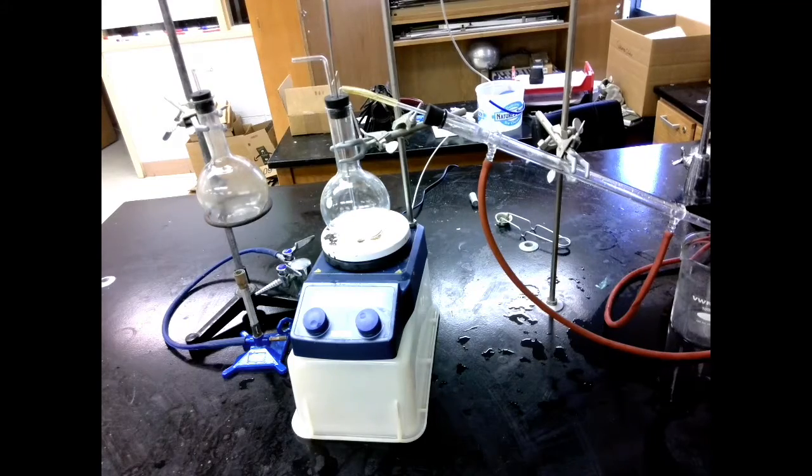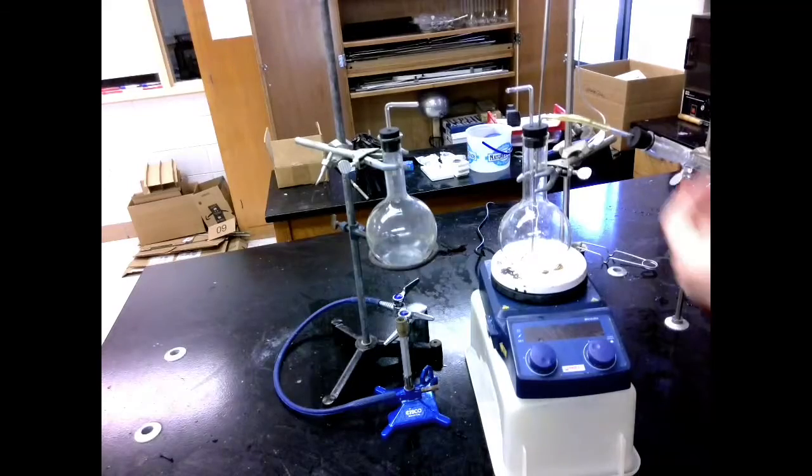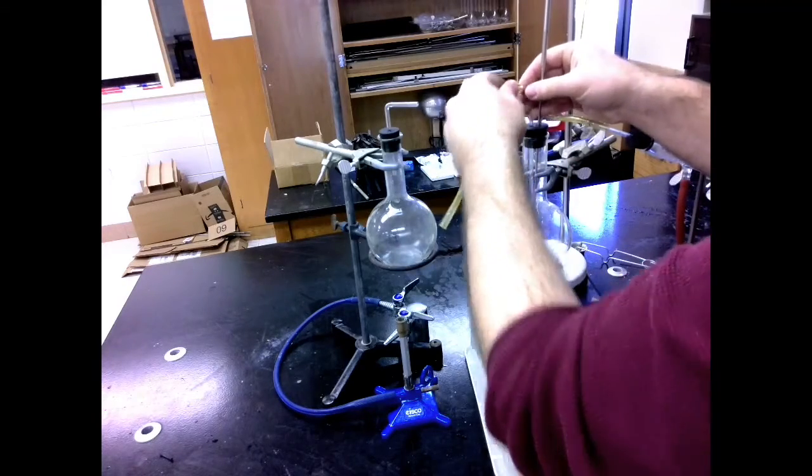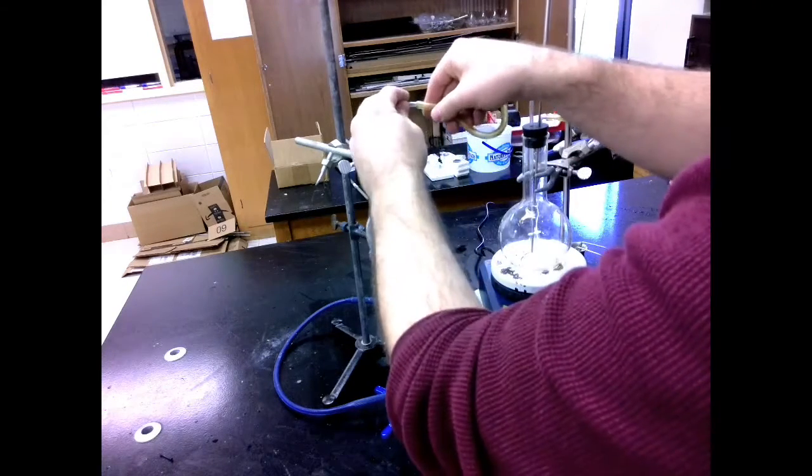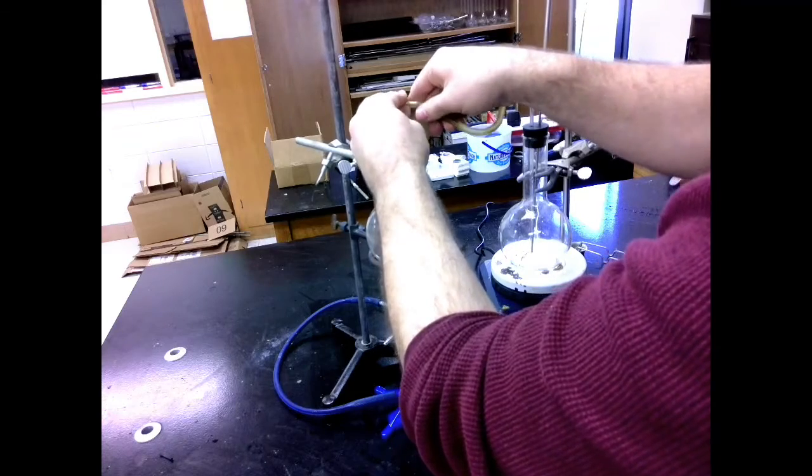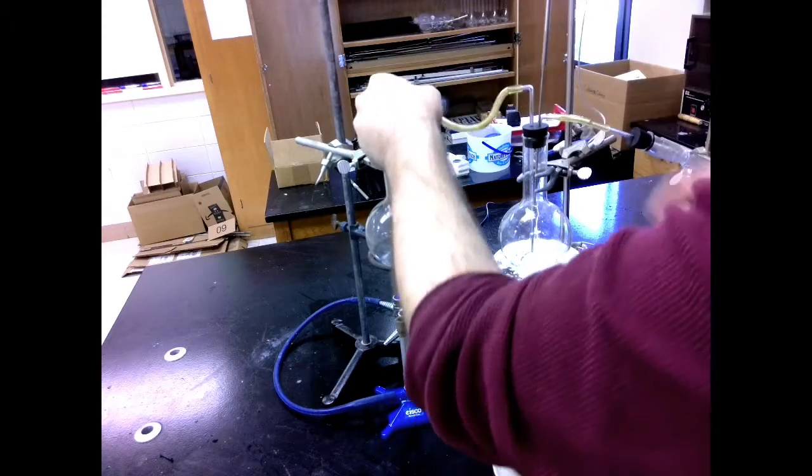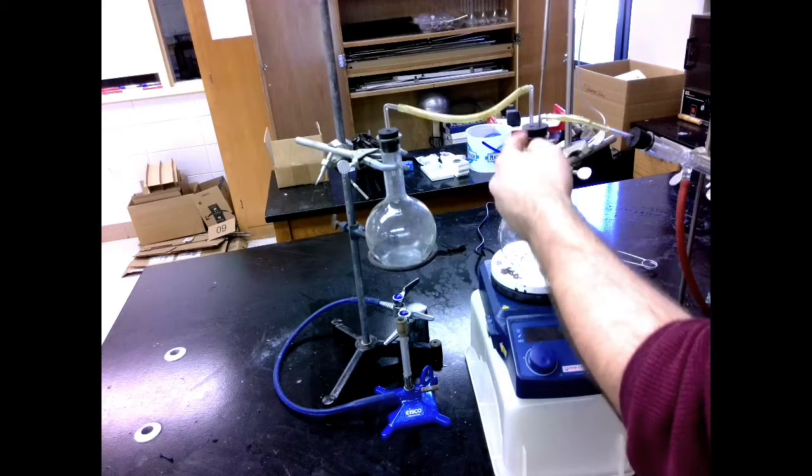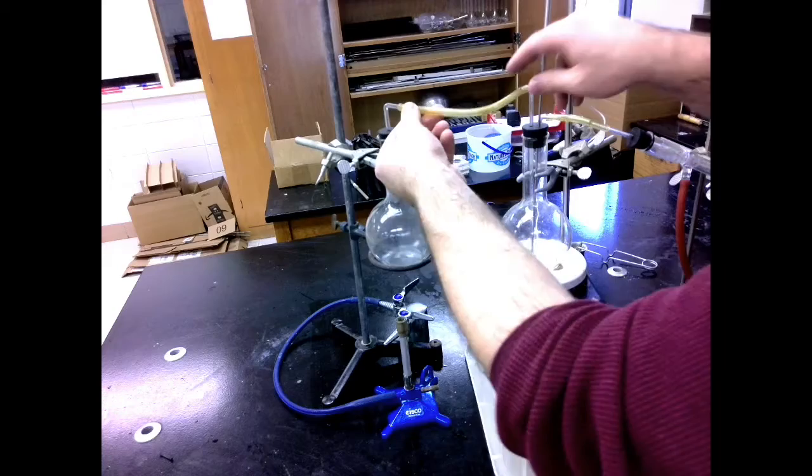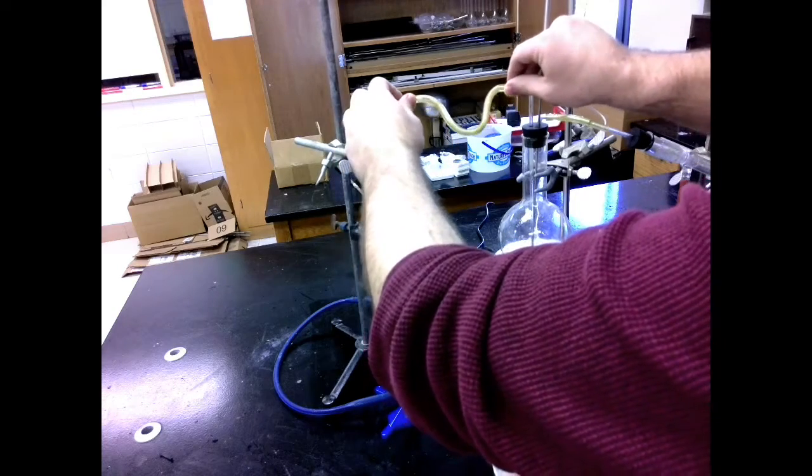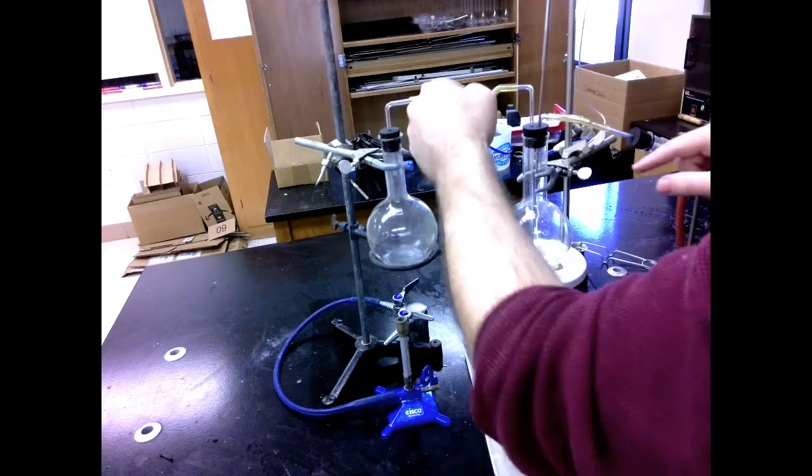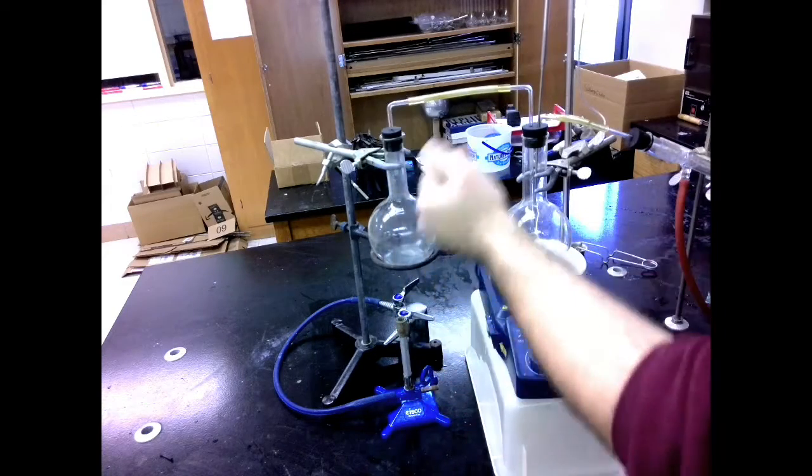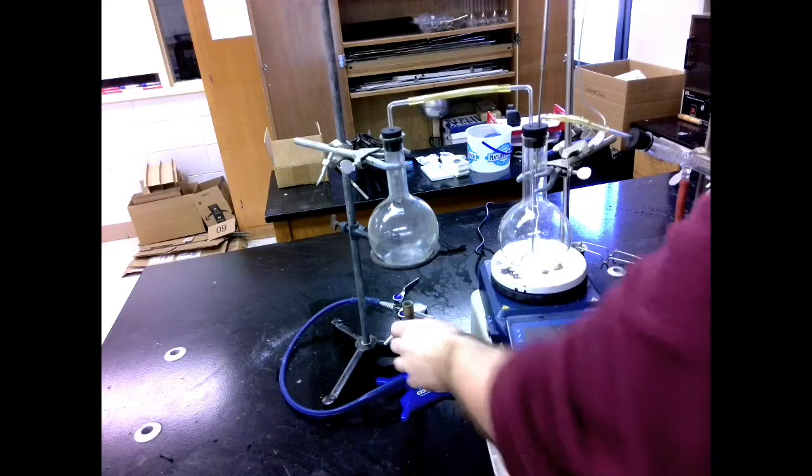Next, rubber tubing on the steam production. I'm going to place the rubber tubing onto the mouth of both of these. Remember that my steam production is going to my longer glass tube. That's going all the way down into here. Now this is even a bit long. My ideal would be having these pointed straight at each other. So I'm going to take this off and trim it. There we go. Now my steam can flow nice and straight. Everything looks good to go.